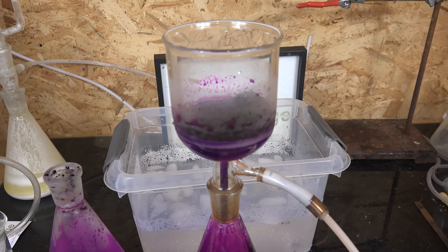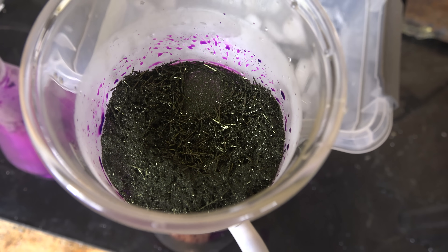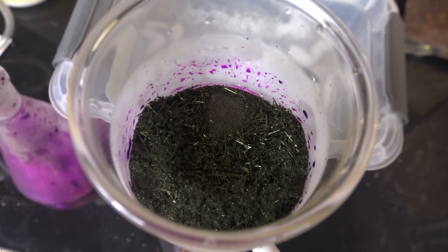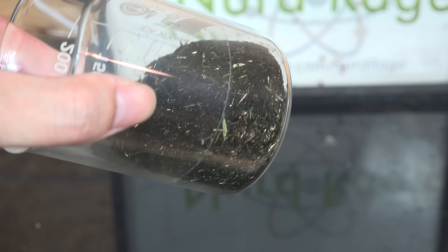But for most amateurs that's a non-issue, and if you're not after the highest analytical-grade purity, then that might be the better recovery method. It's still going to be better than 90% pure. With results like this, I think we're still doing great.